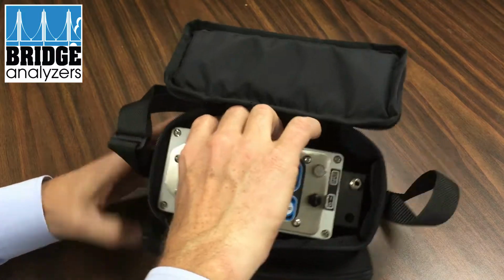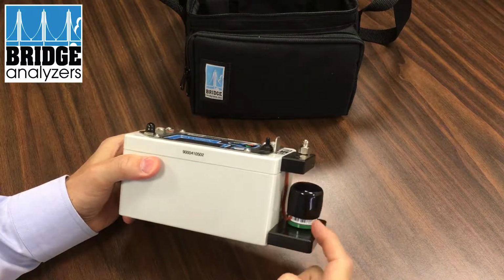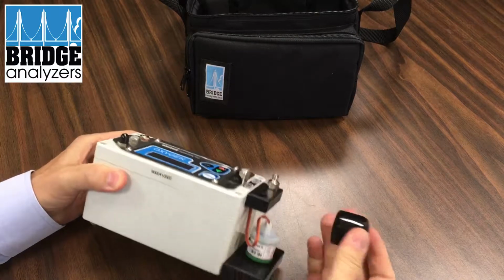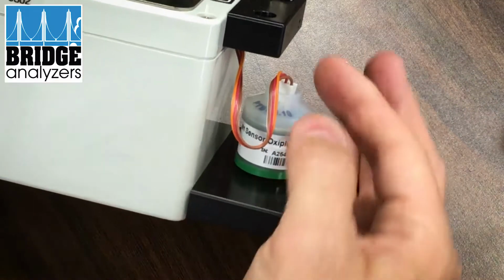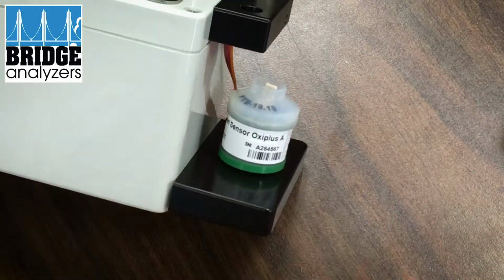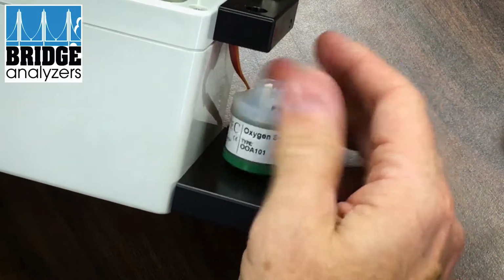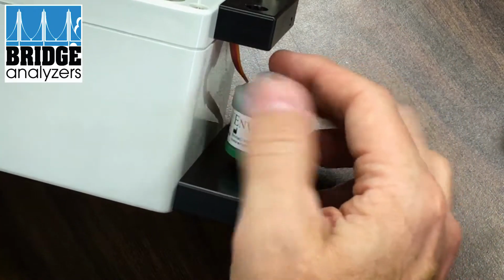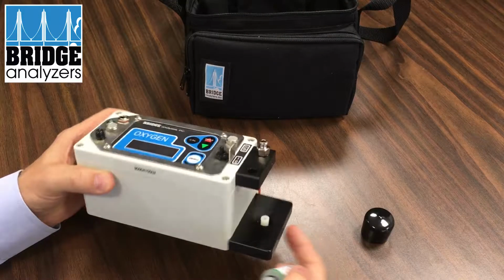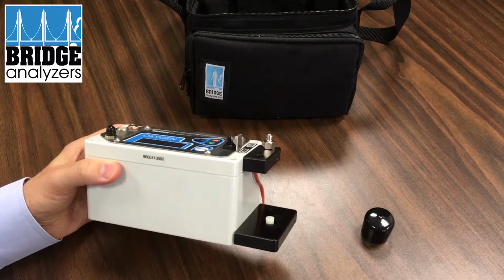And then we pull the analyzer out of the case. And that reveals the oxygen sensor, which is right here. We remove the black cap, unplug the connector, and now we can unscrew the oxygen sensor. It has an O-ring seal and screws into the base manifold there.